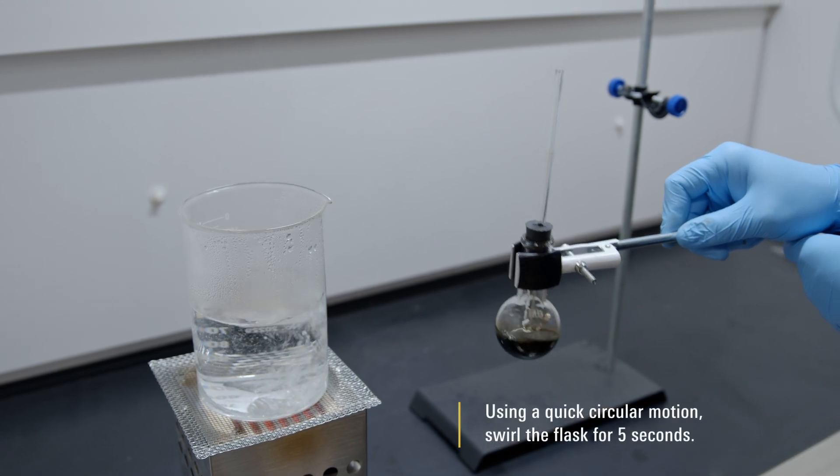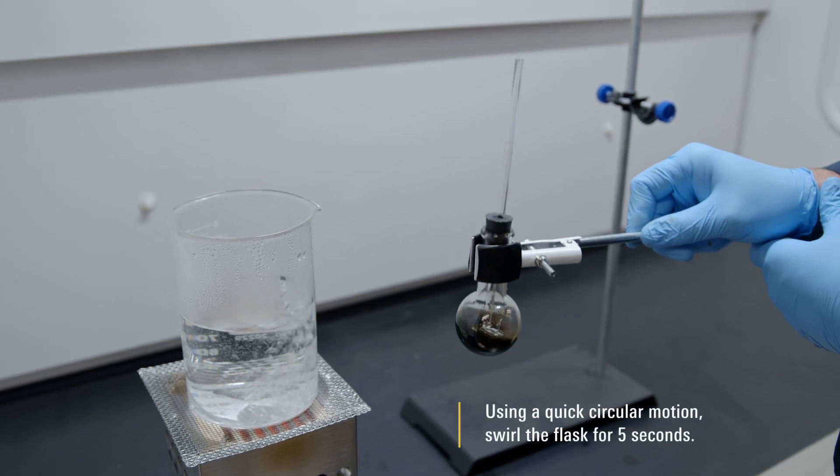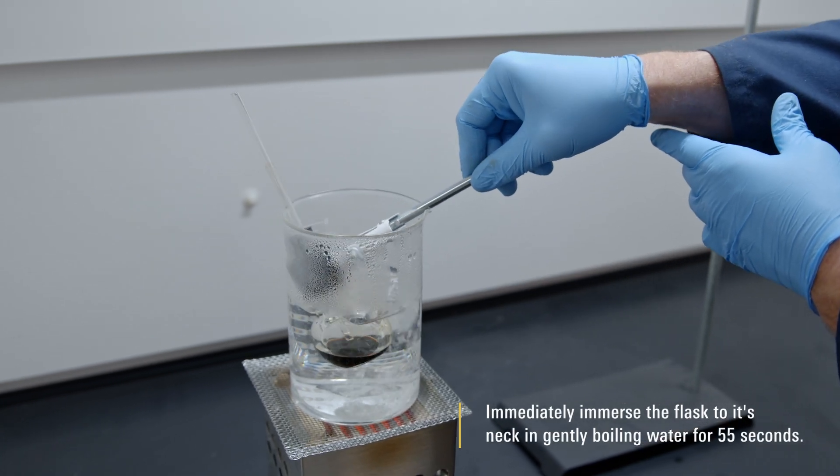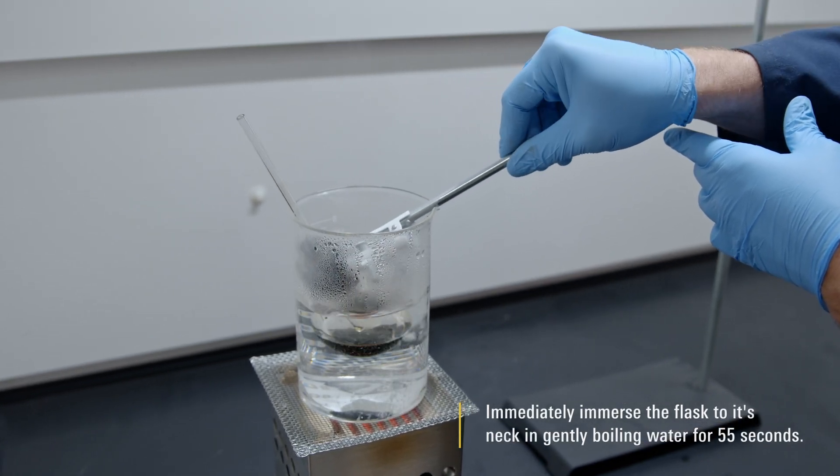Using a quick circular motion, swirl the flask for 5 seconds. Immediately immerse the flask to its neck in gently boiling water for 55 seconds.